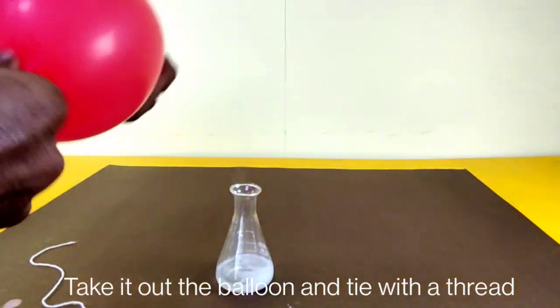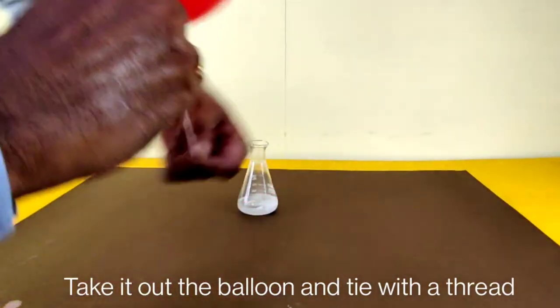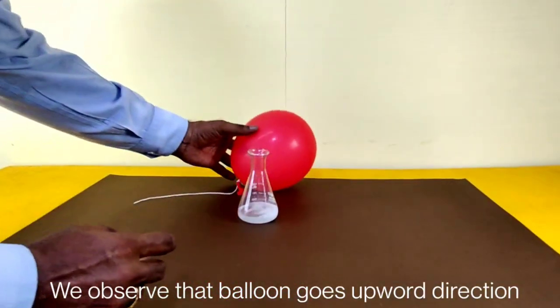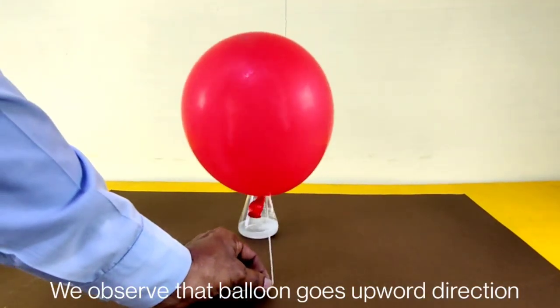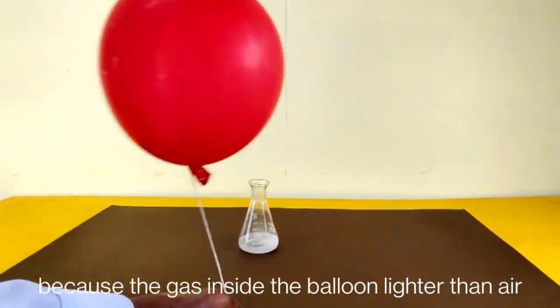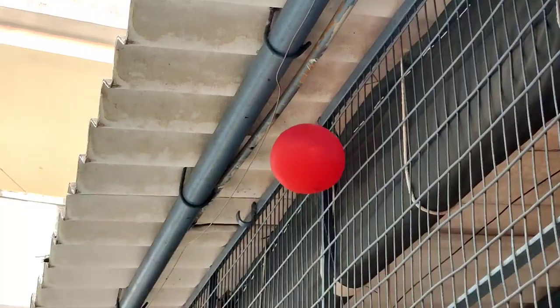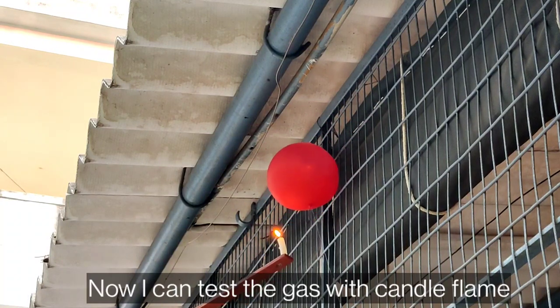Take out the balloon and tie it with a thread. We observe that the balloon goes up. Now I can test the gas with the candle flame.